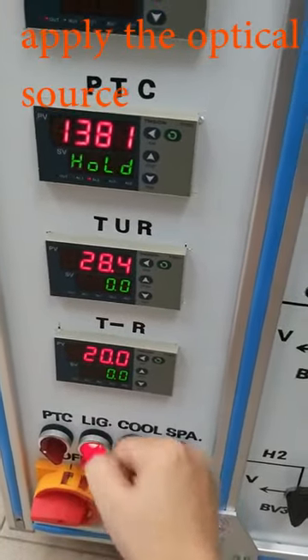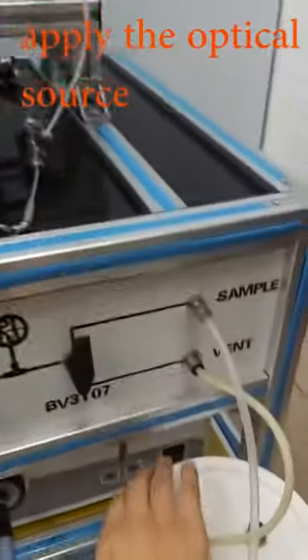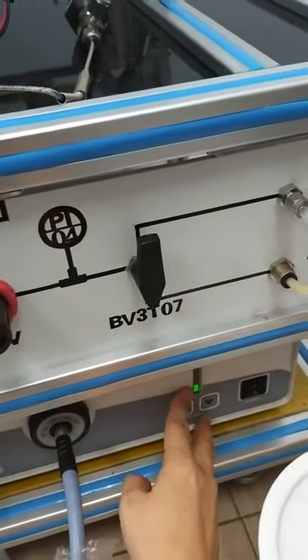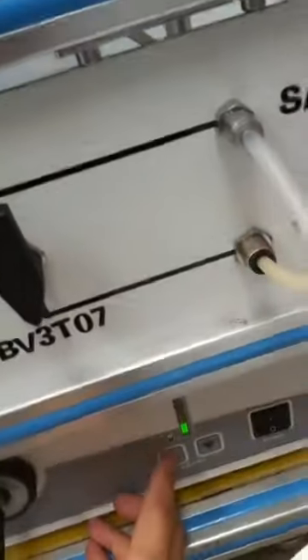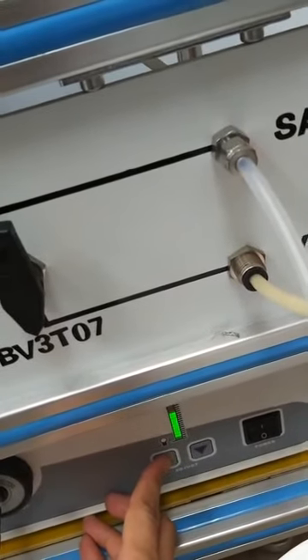Turn the light button on when everything is ready. Then turn on the light through this button. The light will turn on now. Increase the intensity by clicking this button.